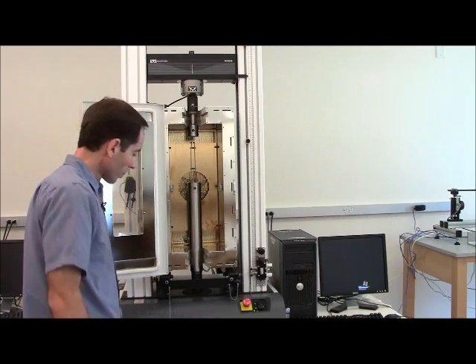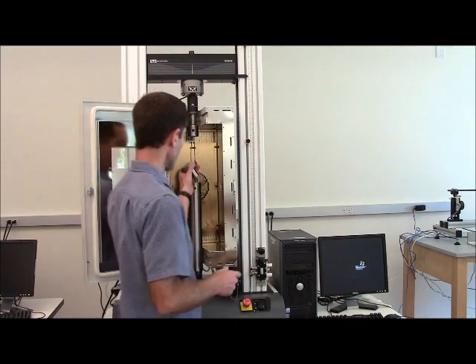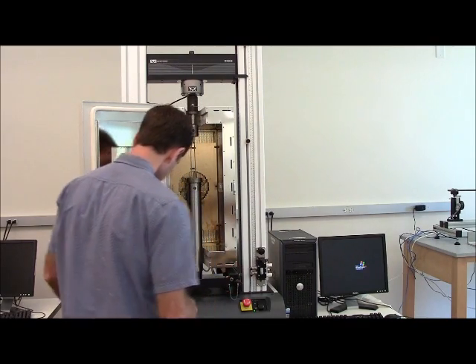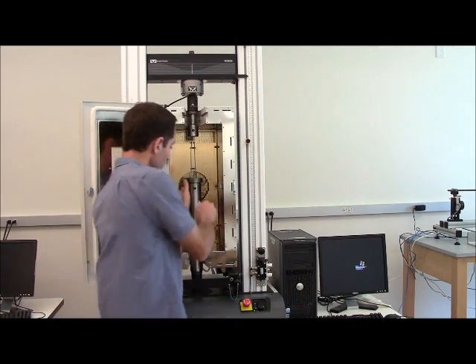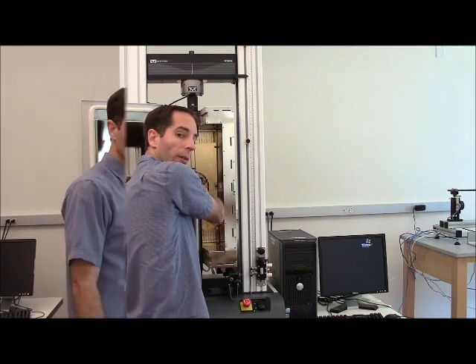I can now take my compression platens and place them into the push rods or pull rods rather. And I'll do the same on top.